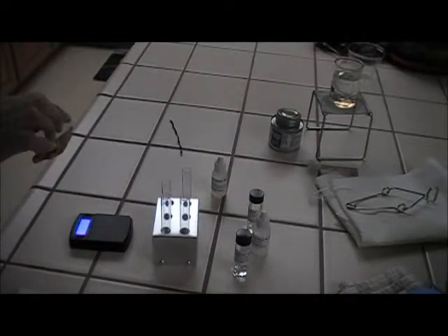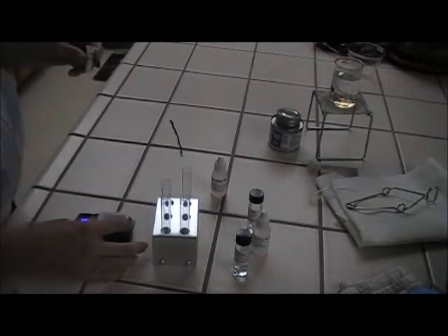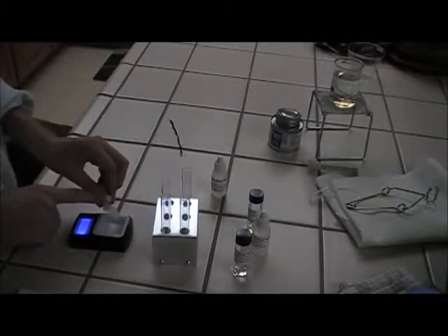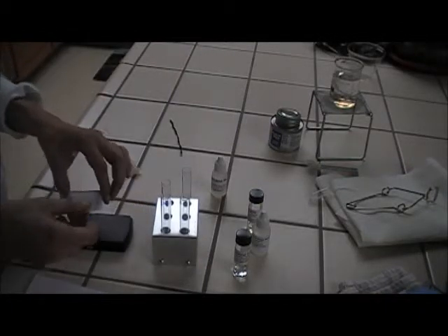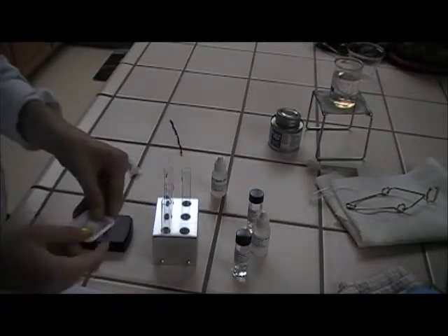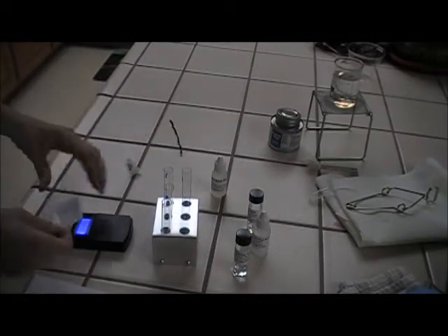A little worried because it's not going. So I'm going to start over. 0.2 grams of salicylic acid. All right, 0.2 grams. Okay, and this is going into test tube 7 back here. So I'm going to move my 5 over here, 6 in the middle, 7 will come to the front since I'm not really using the other ones. All right, salicylic acid in 7.